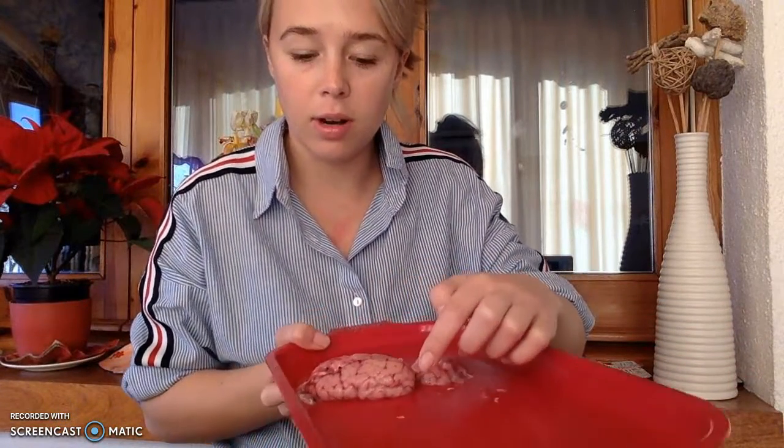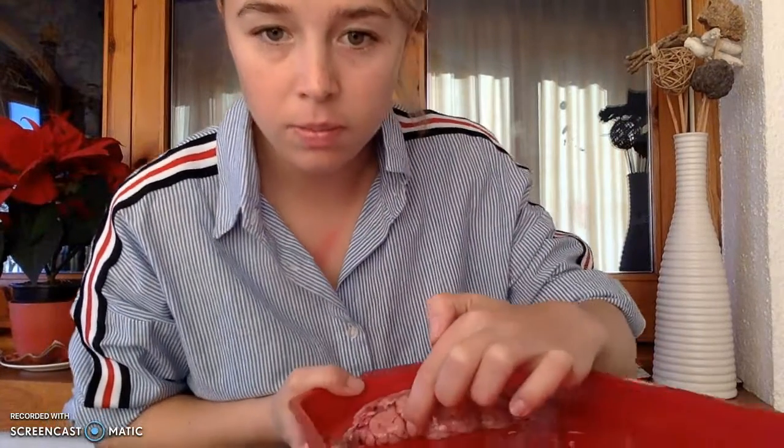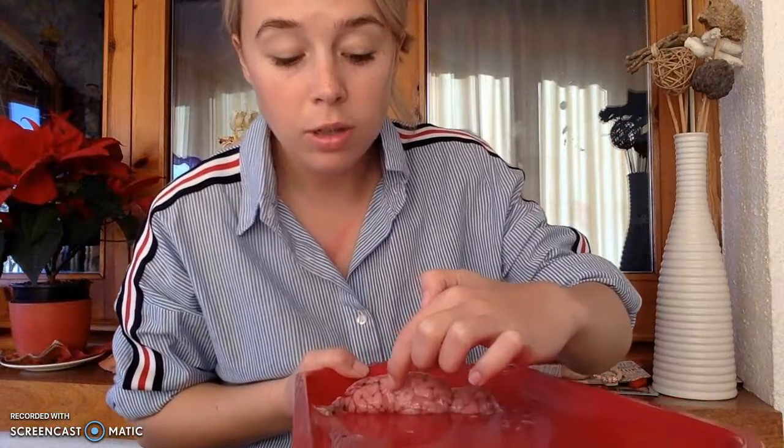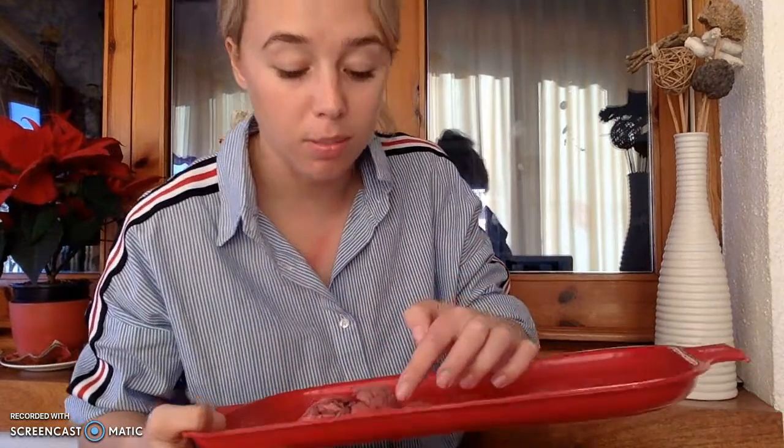That's our longitudinal fissure. And then our lateral fissure, which is visible from the side of the brain, starts here, and then it traces its way up this way. This is the lateral fissure from here to here. I know that wasn't the best trace with my finger, but it is right there.